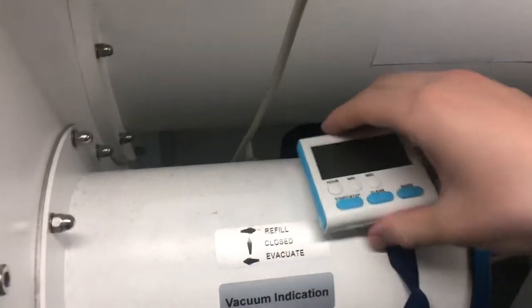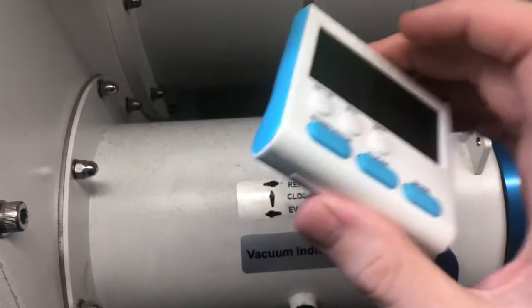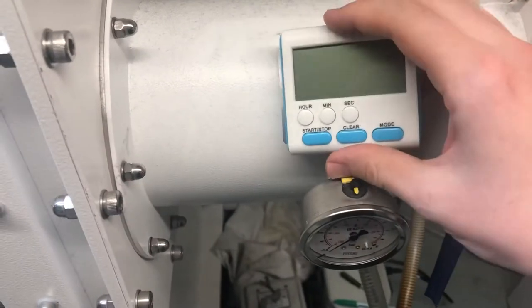We need a new AAA battery for this, but this timer does work and it will be used for what I'm about to show you.